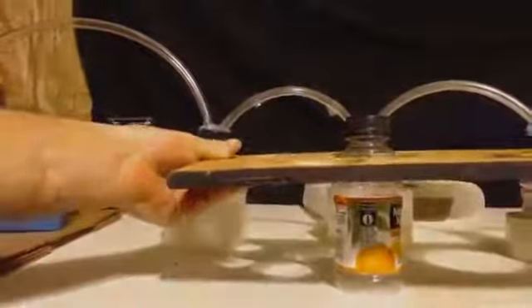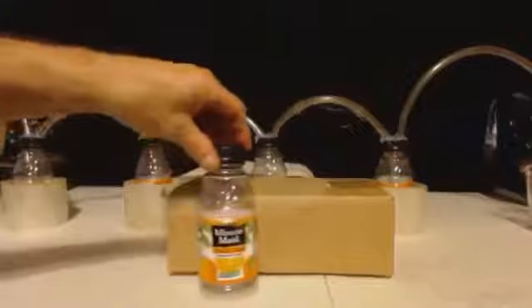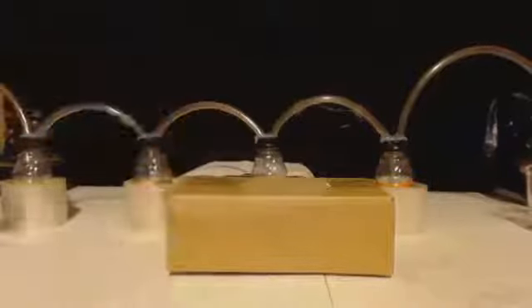Make a roof, a ceiling, and then go get some wood and make some walls for that, just like a test tube holder. That way, when you put your tubes in, your bottles are sitting there and nothing's moving around. And if you don't have that, you can even use a cardboard box. Just get a knife or whatever, as long as it's a little bit shorter than the bottle. You can cut some holes in it and put the bottle in the hole so that it helps sturdy it out.